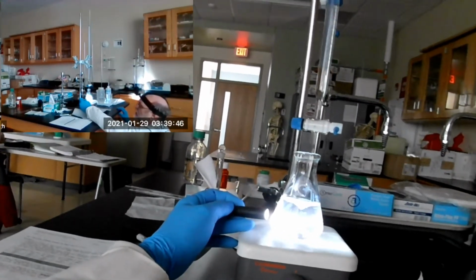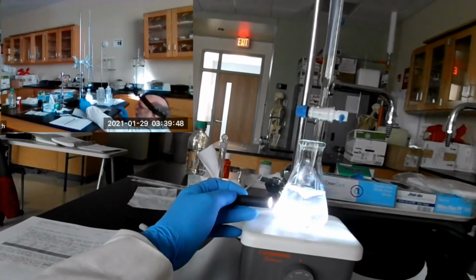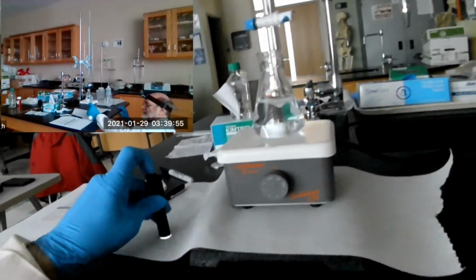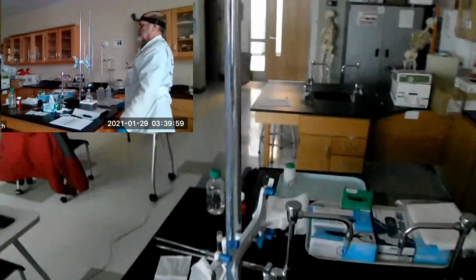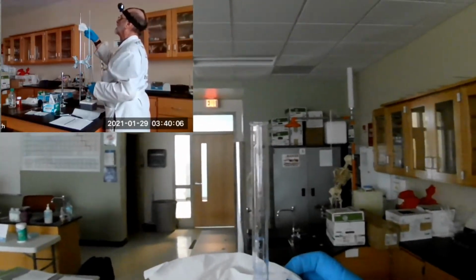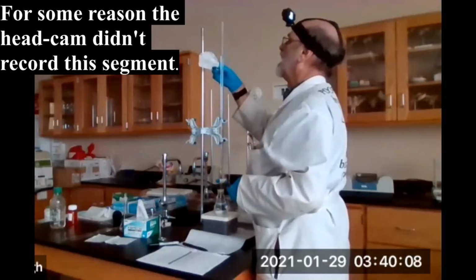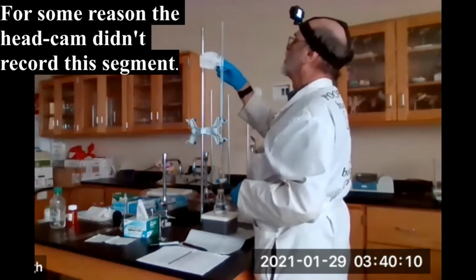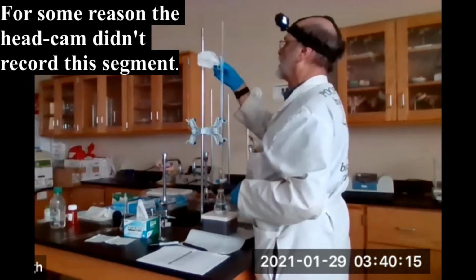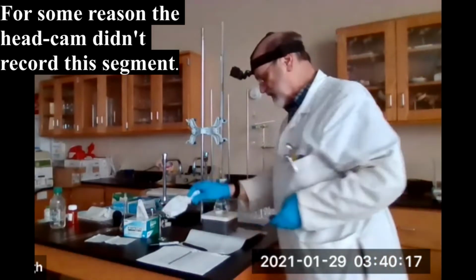So let me take a reading. And that'll take a few seconds, and then we'll come back and check to be sure that the silver chloride is still there. So let me read it. You know, the background. This might work better. I don't even like it. So this is 0.567, right on the money. 0.70.